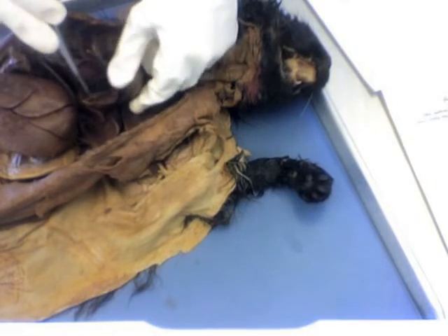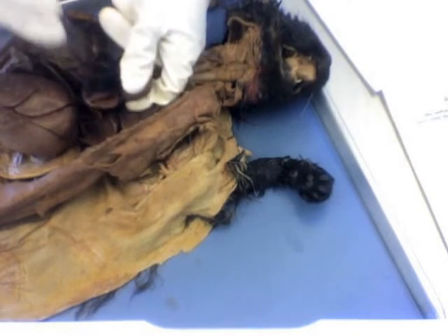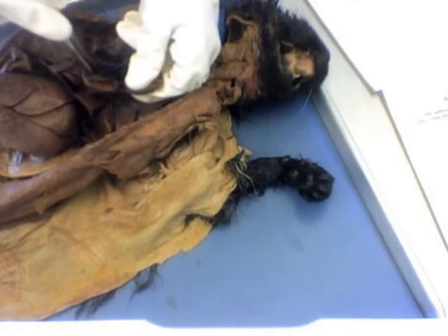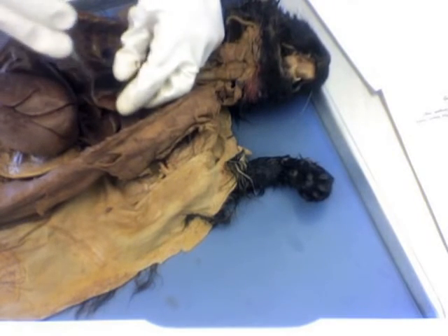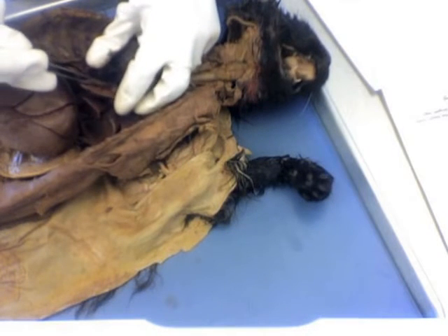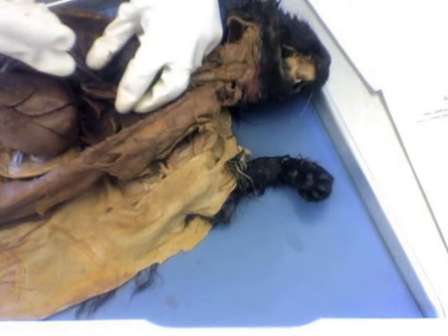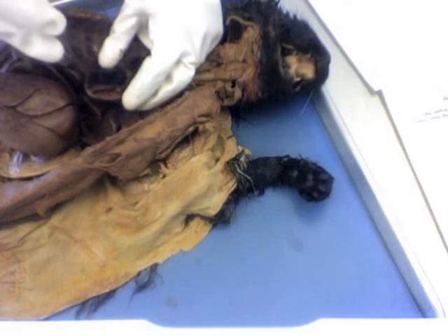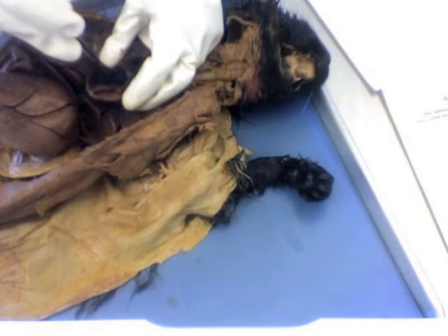So as far as internal anatomy of the heart is concerned, we'll take another look at this on the heart model, but you can see the interventricular septum quite clearly here on the heart. And you'll notice that the muscular walls around the left ventricle are much thicker than those around the right ventricle.